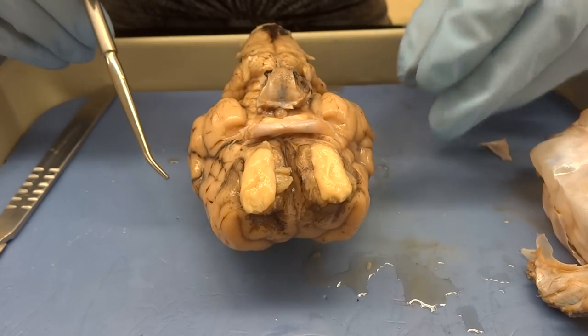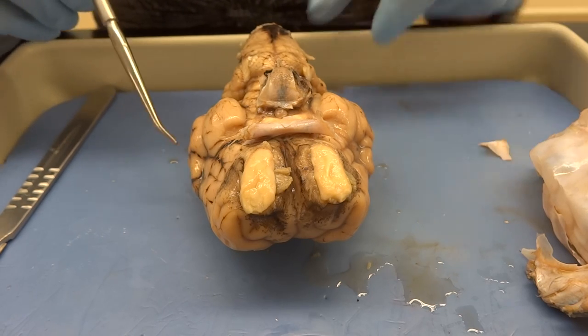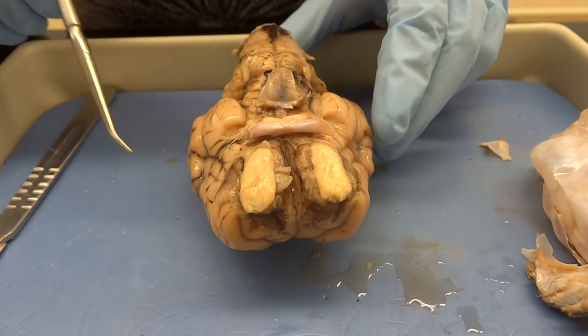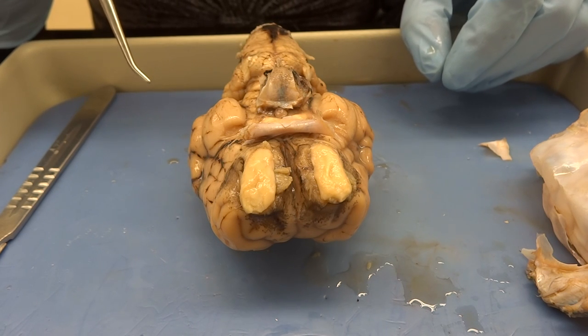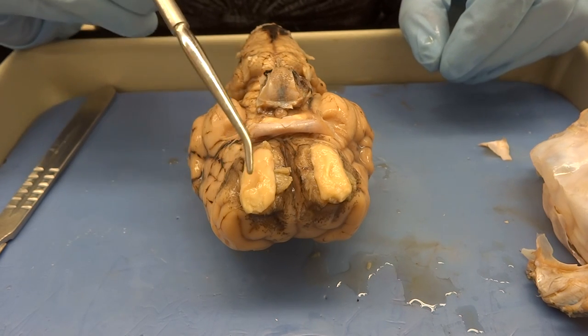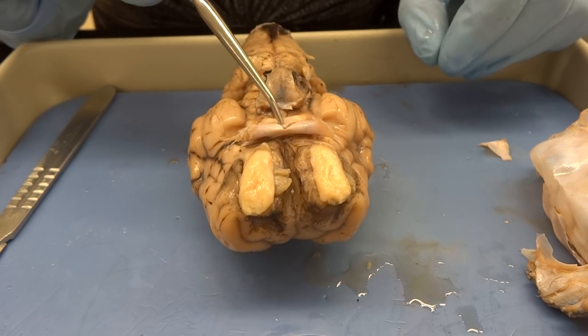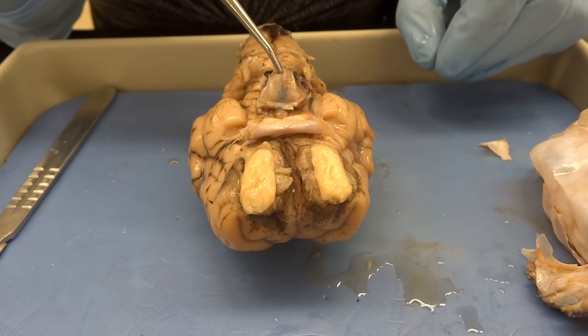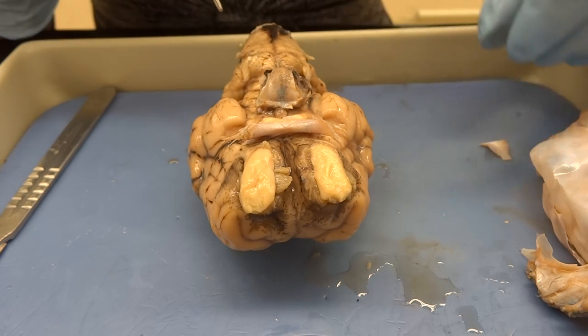Now Marsha's going to go through some more brain bits, and then I'll start cutting the rest of the dissection — cutting down the middle. You can see straight down right here the olfactory bulb, and then the optic nerve, or the optic chiasma, and the pituitary gland, which is held on by the infundibulum — my favorite word to say.